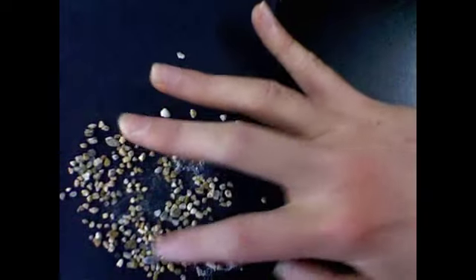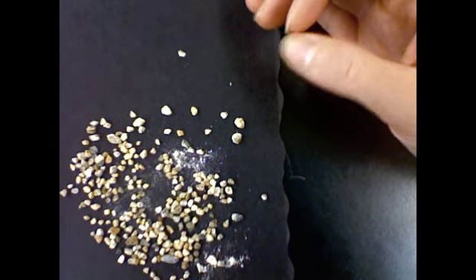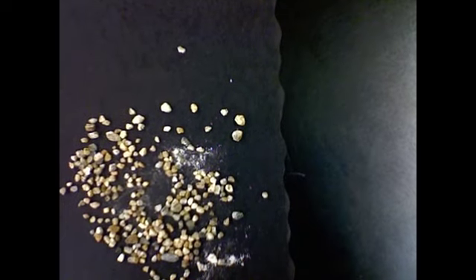I found myself wanting to say that they have an irregular shape, meaning nothing you can really predict. Each one's a slightly different shape than the other. So that might be an important property to note because it could be useful later on. Definitely.